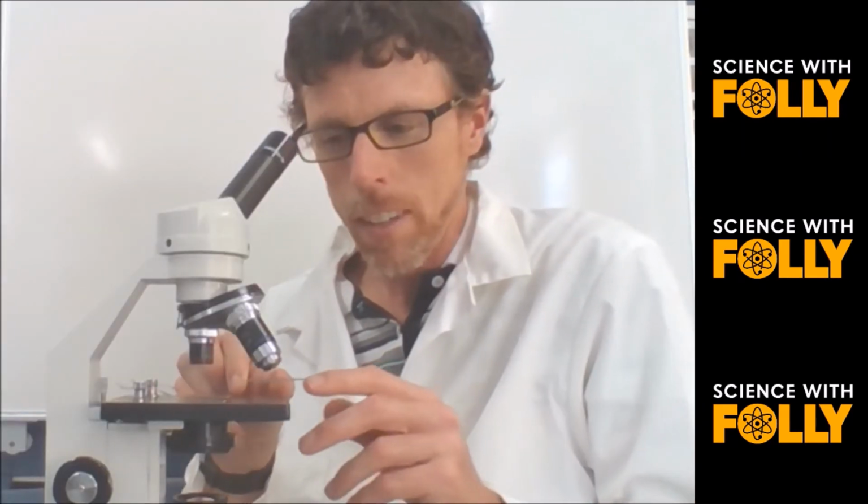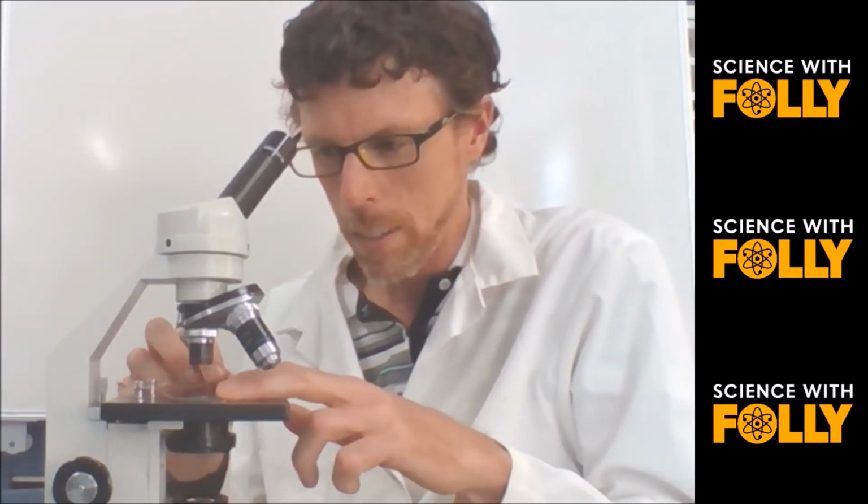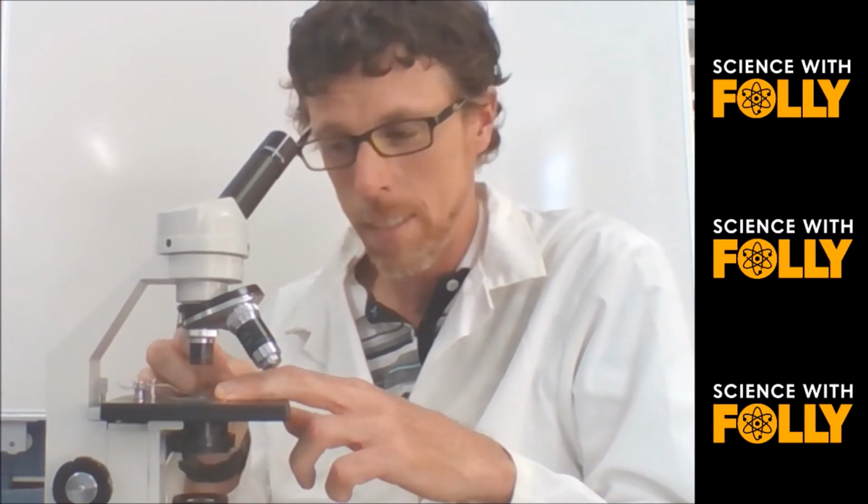So to view your slide, you put it on the stage, hold it down with a clip, make sure your sample's right in the center. Make sure you start by using the smallest objective lens. So in this case, it's the 4 times, or 4 times 10, giving me 40 times magnification.